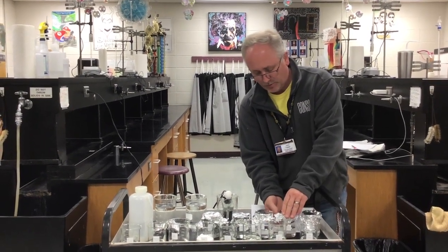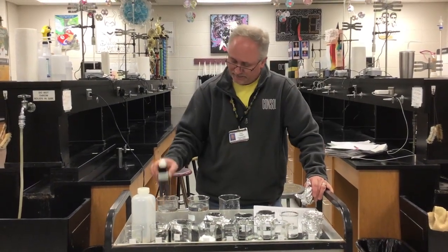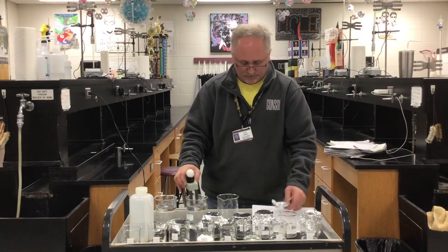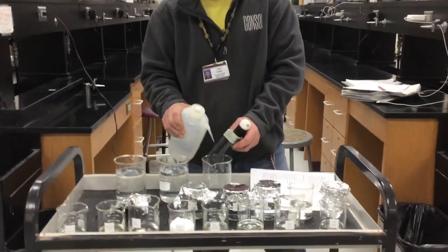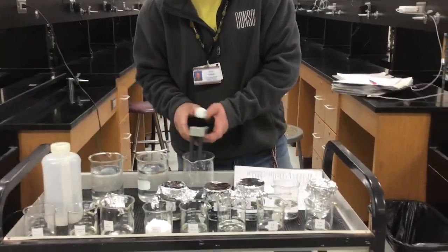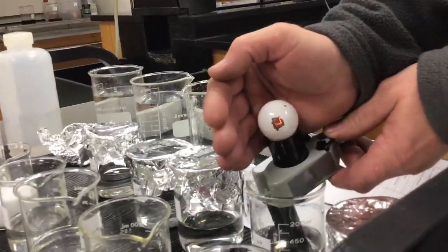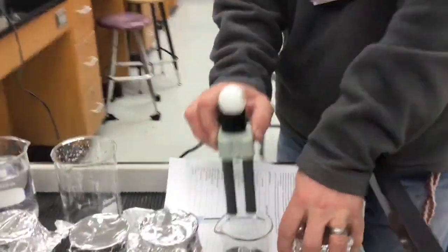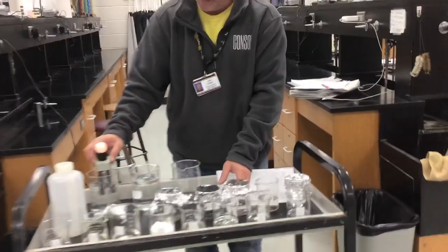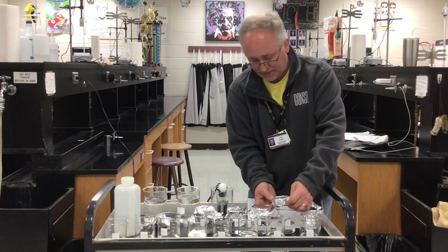The next one is 6 molar, so this one has some water in it, and so we might see something a little bit different. You may have to get close on this one to see it. This is 6 molar ethanoic or acetic acid. You might even have to look in there to see that it is lighting up a little bit. It's the same acid, but this one has a little bit more water in it, and so it's actually able to ionize. Washed out. That's stinky.